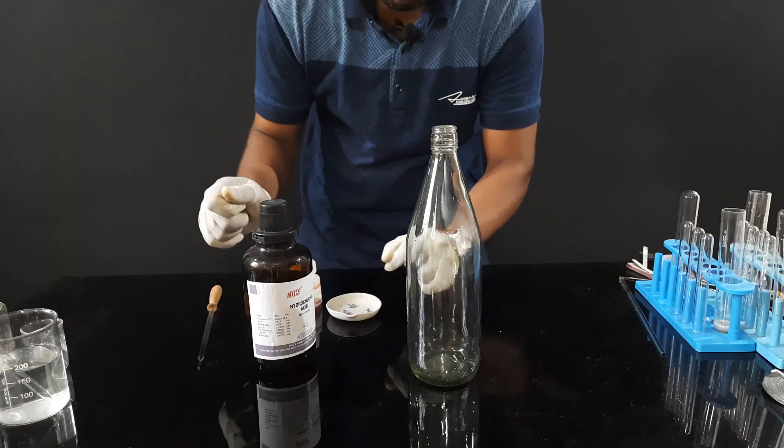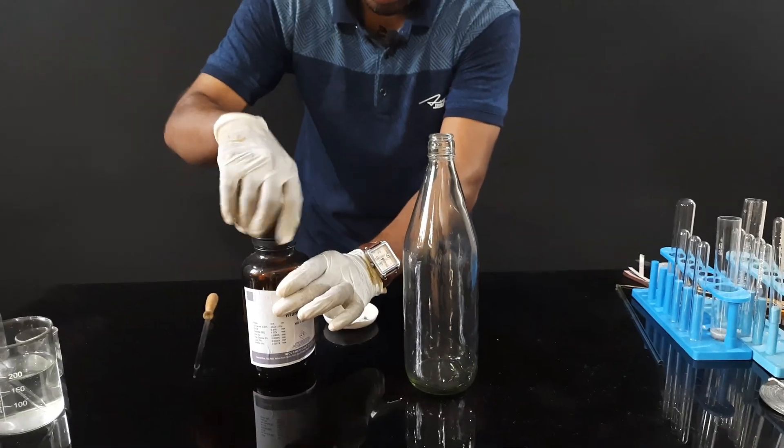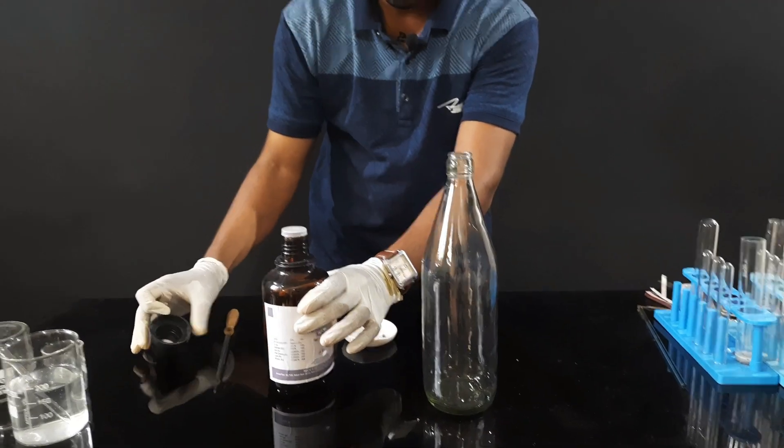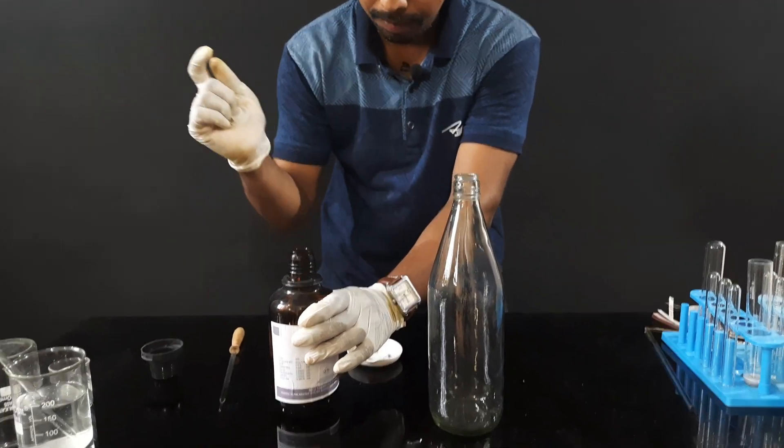Today's video is to start the NCERT Class 10 acid-base-salt chapter, Activity 2.3 reference video, which is called Hydrogen gas release. Hydrogen gas is released using hydrochloric acid. What's the result on the screen?